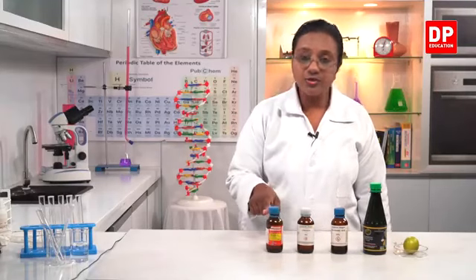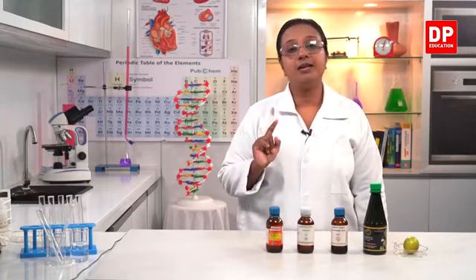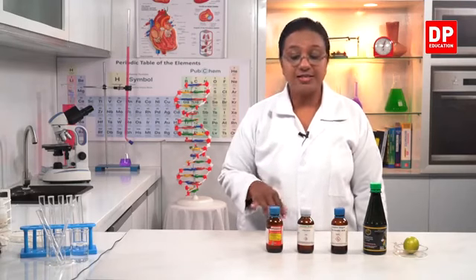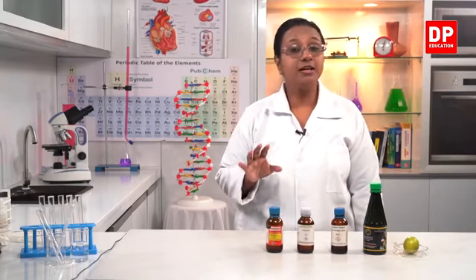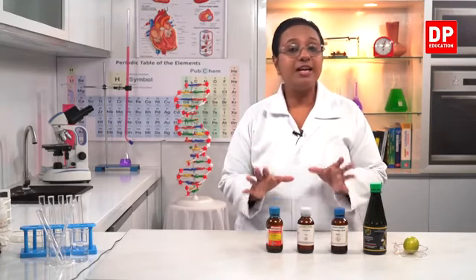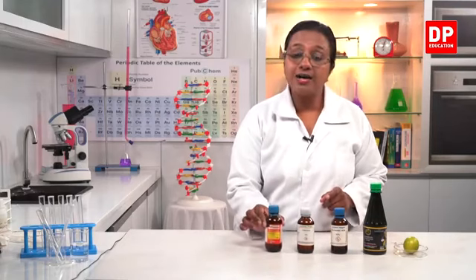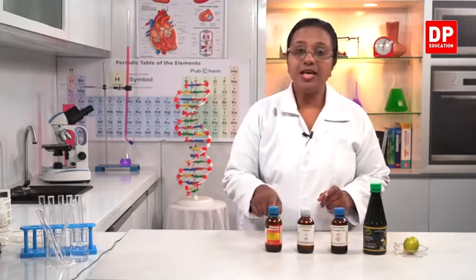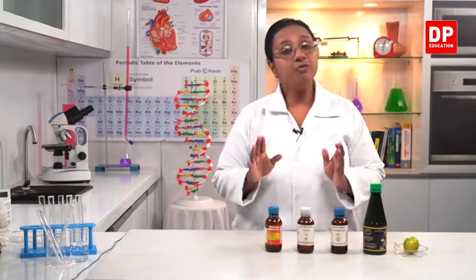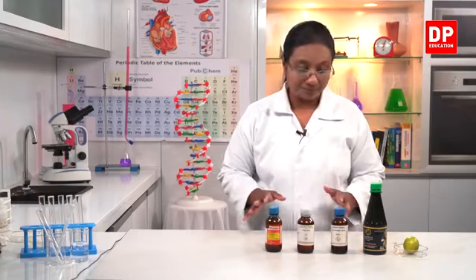Now first look at how they are stored in the lab. Now they are kept inside a brown colored bottle. What is the reason? Because these are very strong acids and usually they are very concentrated. Highly concentrated acids. Therefore, in order to prevent any reactions, they are stored inside brown colored glass bottles. So the first three are strong acids that we use commonly in the lab. But you all know we can dilute these and use them as the dilute acids as well.